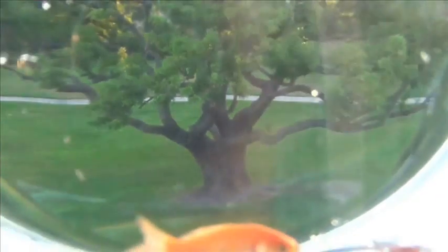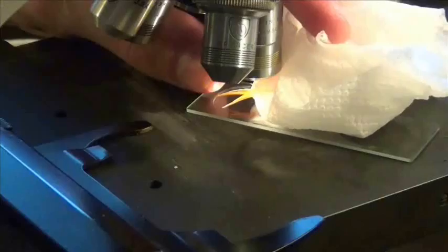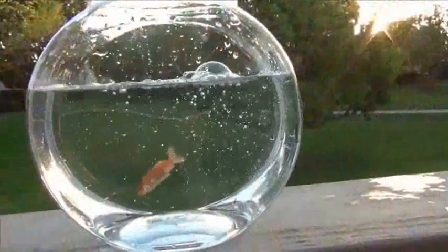How many cells do you think are in this fish? Let's take a look. By putting the fish's little tail under the microscope, we can actually see the red blood cells in the tail and watch them move with every heartbeat, both to and from the heart, in the veins and arteries. The fish is returned unharmed.